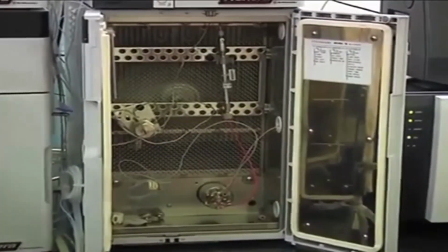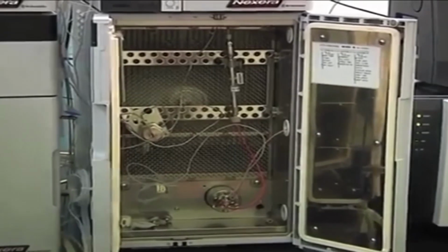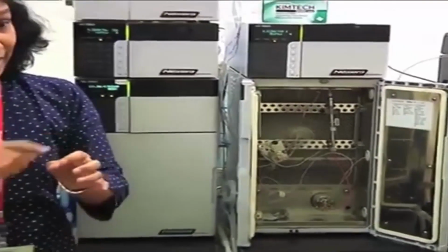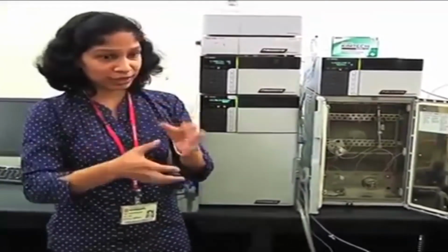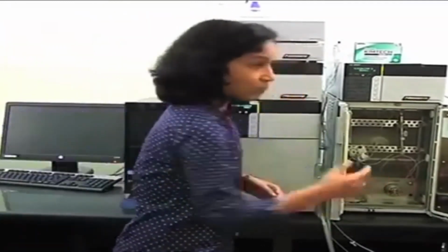So generally I told you this is a fast HPLC system. So the main use of a fast HPLC system is reduction in the analysis time. If my analysis time is only 5 minutes or 10 minutes, and in that I want to do gradient analysis, that means my A to B concentration is continuously changing, my mixer should be so efficient that within that smaller amount of time it should give me proper mixing. So this mixer is specifically designed with microreactor technology, so its mixing efficiency and mixing accuracy from run to run is very good.